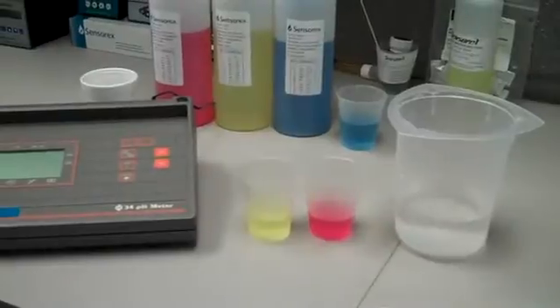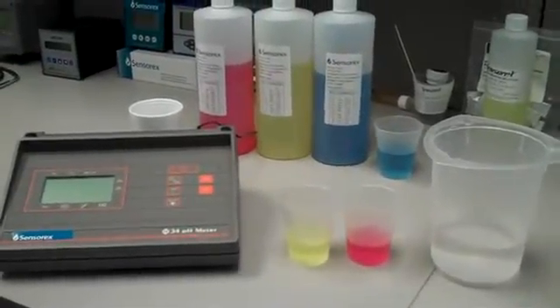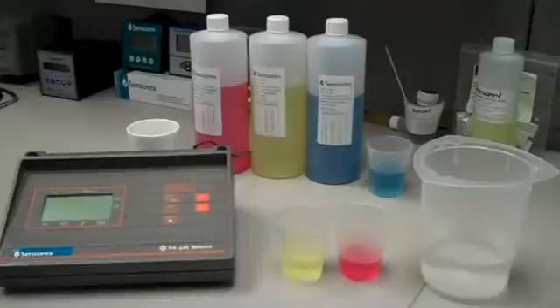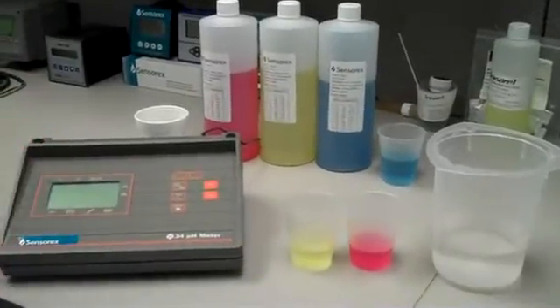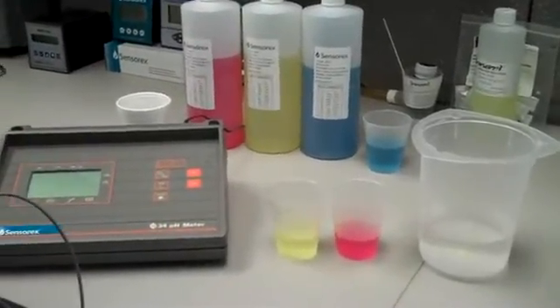pH buffers are specially formulated salt solutions with precise pH values. The calibration technique for using a benchtop or desktop or a pH controller are all the same.